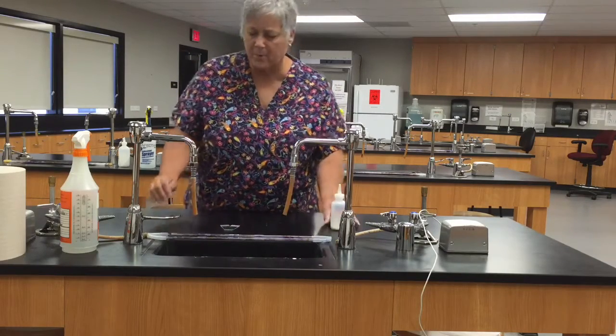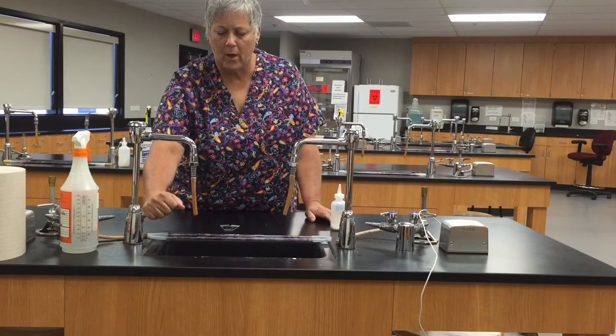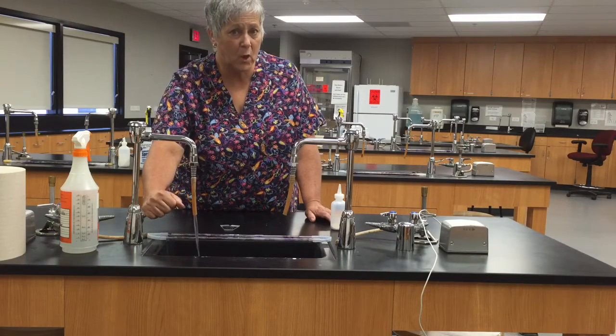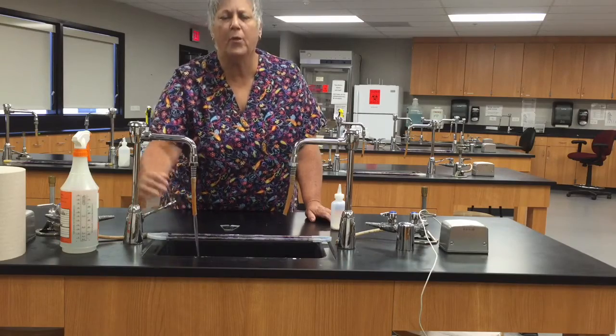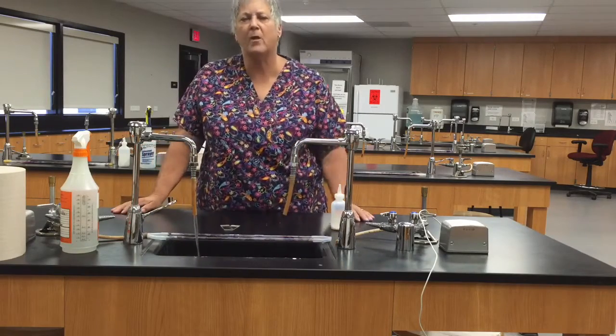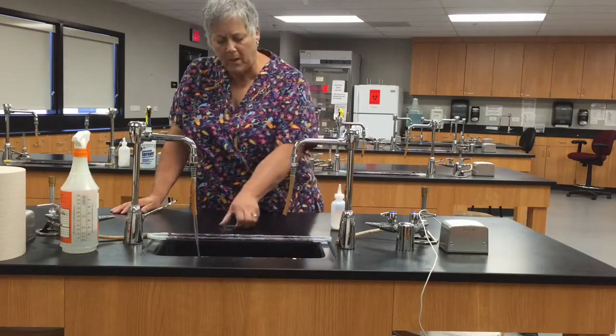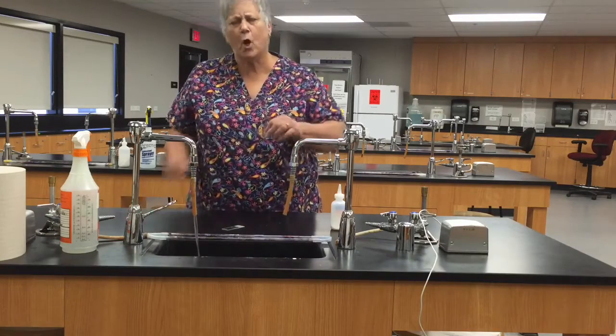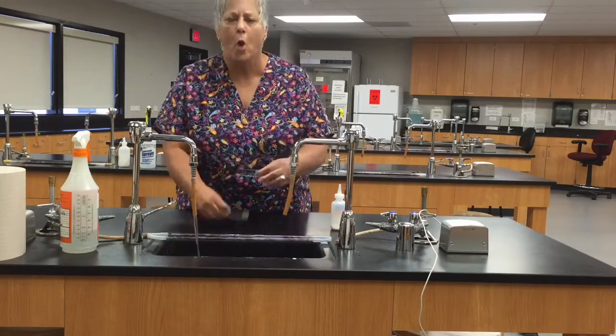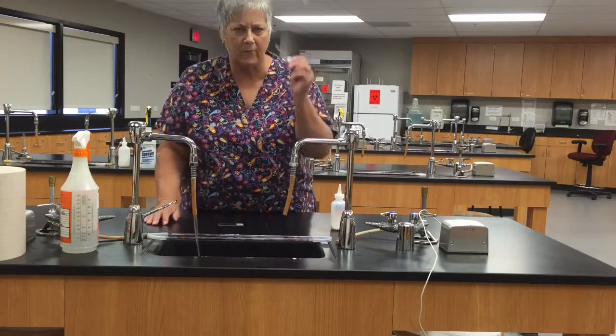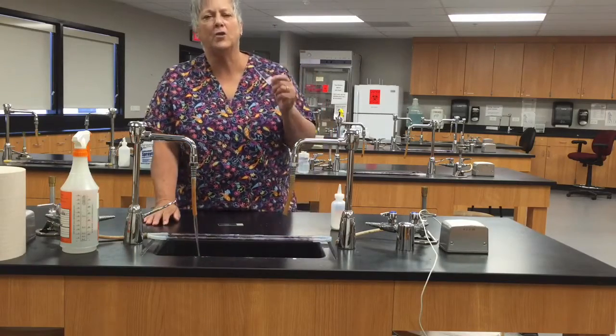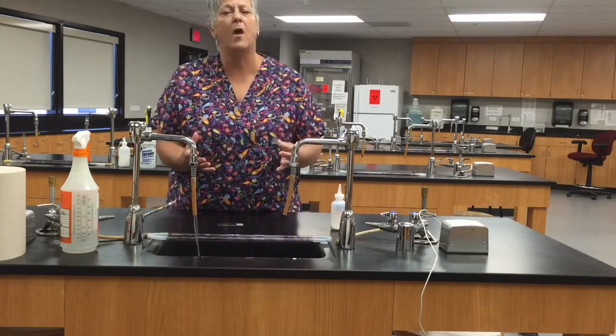Now the first step is always going to be the same and that is you will get a couple of microscope slides and even though they're new, you're just taking them right out of the box brand new, the manufacturer put some kind of a coating on the slide so that they don't all stick together in the box and so the first thing you need to do is wash that off thoroughly. You don't need gloves for this part.